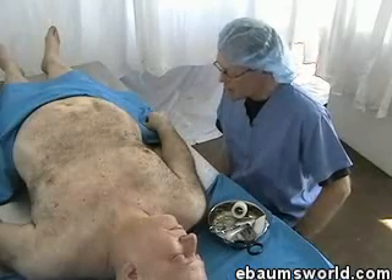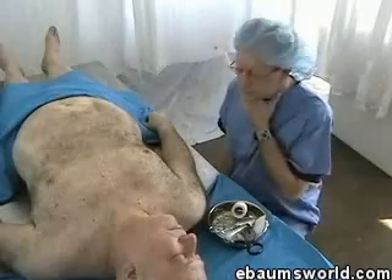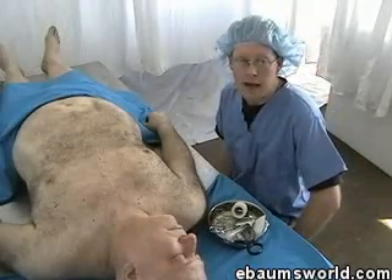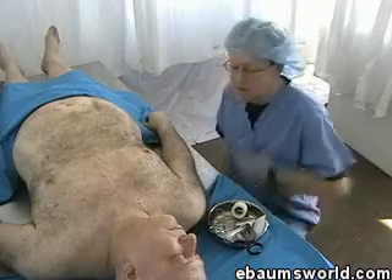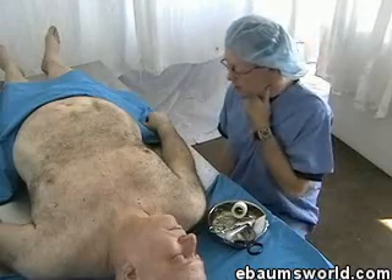Today I'm going to be practicing isolating the carotid and vertebral arteries on both sides. I need to isolate the ones that supply the neck and the face, and sort of tie them in — both superficial and deep ones.